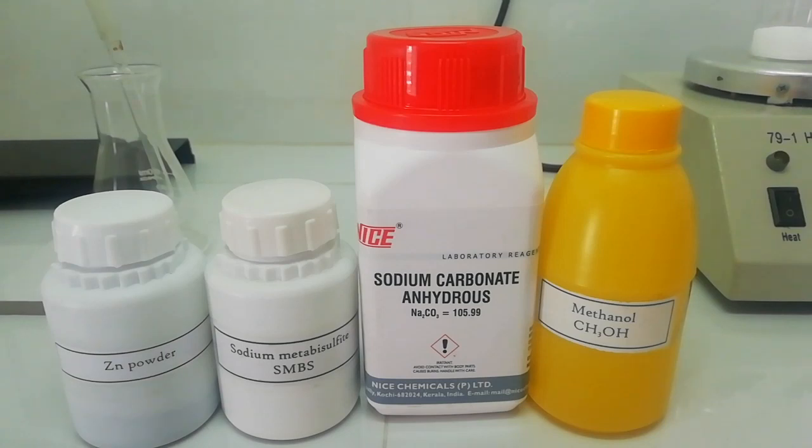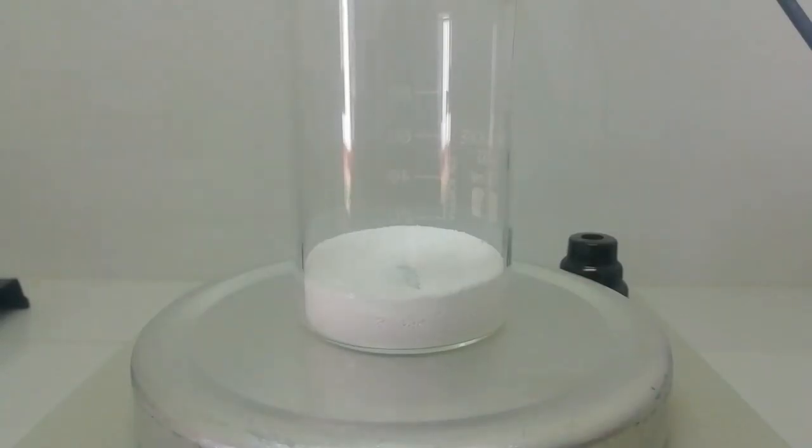The first step is converting this sodium carbonate to sodium bisulfite. If you have sodium bisulfite, you can continue with that step. Right now you can see I have taken 20 grams of anhydrous sodium carbonate.